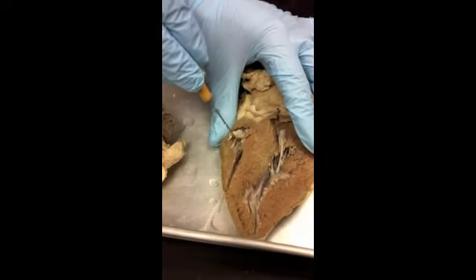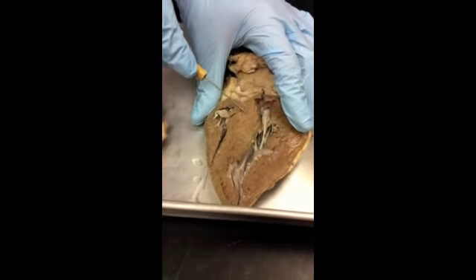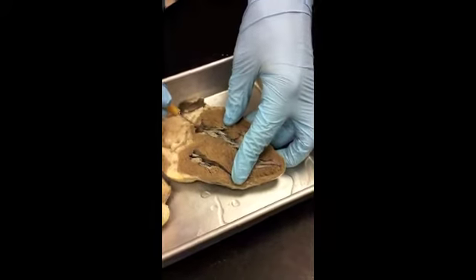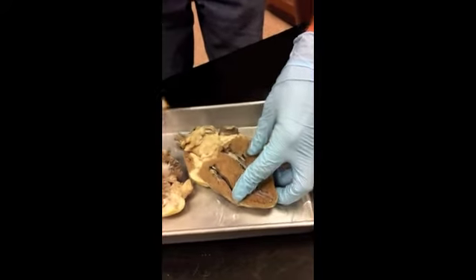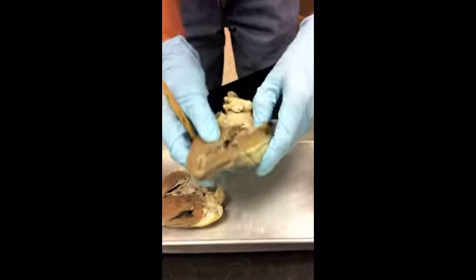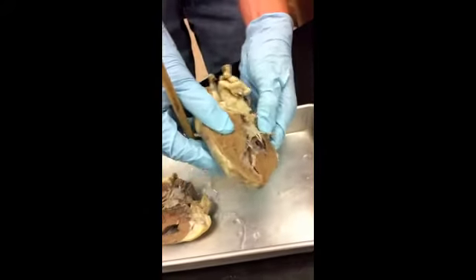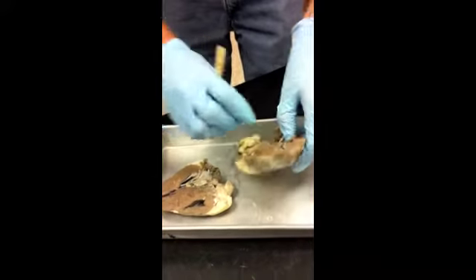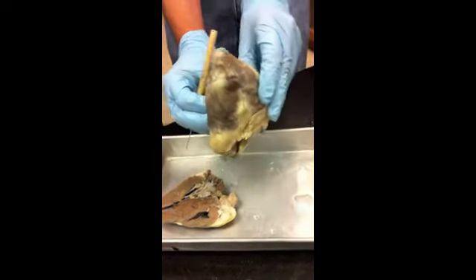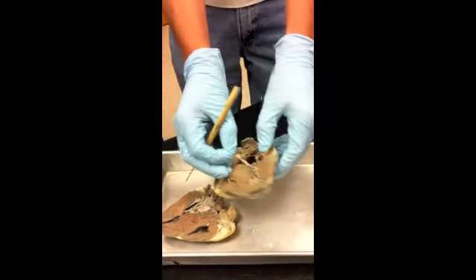So papillary muscle, chordae tendineae. This is the right ventricle. This, again, is the interventricular septum. This is the left ventricle, which means that this is the bicuspid valve, again, with the chordae tendineae. And let's see, if we open this up a little more, you can really get a good look at that valve, that tricuspid valve. And if I grab this piece of chordae tendineae right there, you can see all the way up to the top of that. But anyway, that chamber inside there is the right atrium.